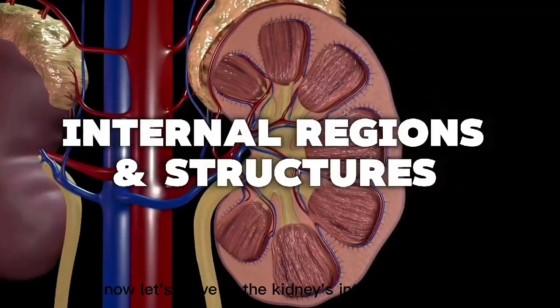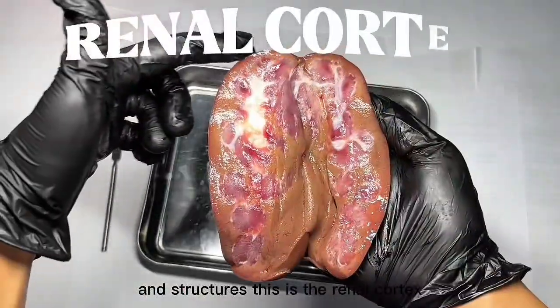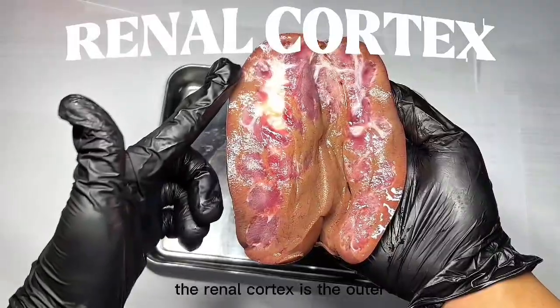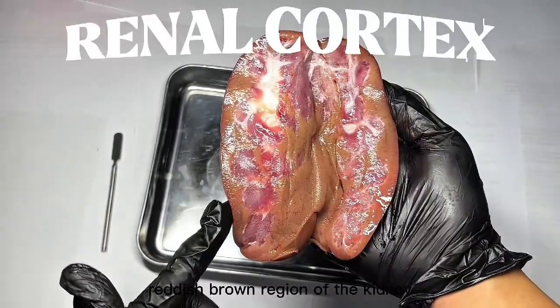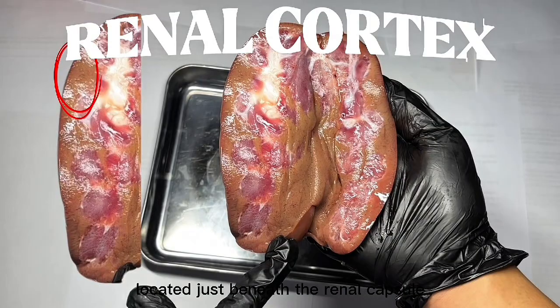Now, let's move to the kidney's internal regions and structures. This is the renal cortex. The renal cortex is the outer reddish-brown region of the kidney located just beneath the renal capsule. It has a soft, grainy texture that contains millions of tiny filtering units called nephrons, specifically the glomeruli and the Bowman's capsule. These structures give the kidney its speckled appearance when viewed during dissection.